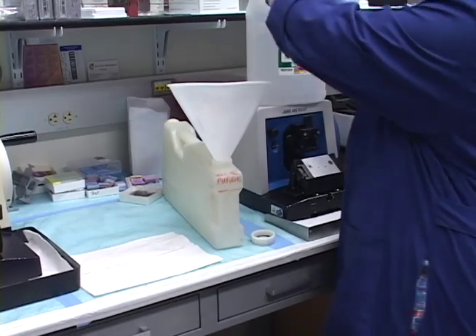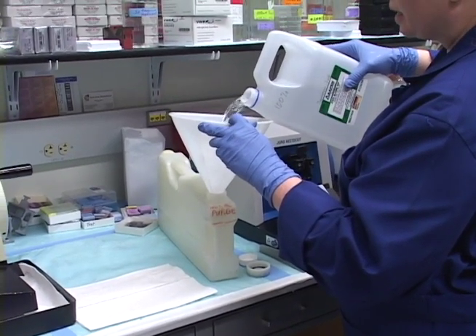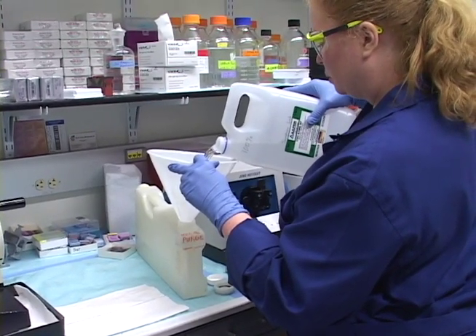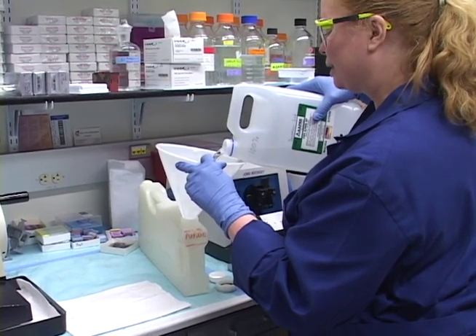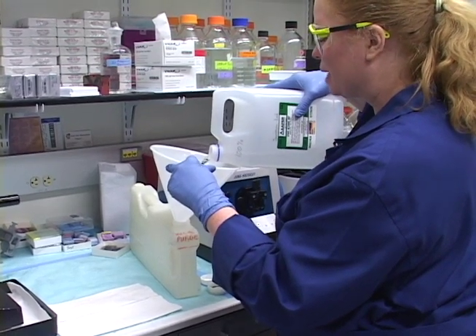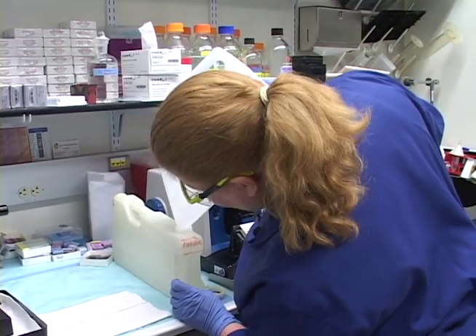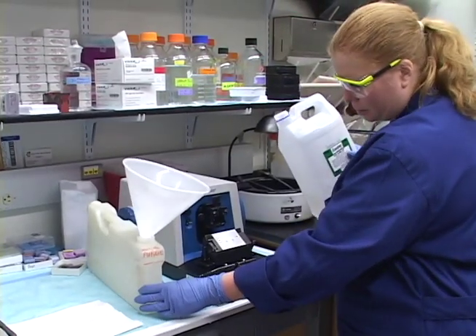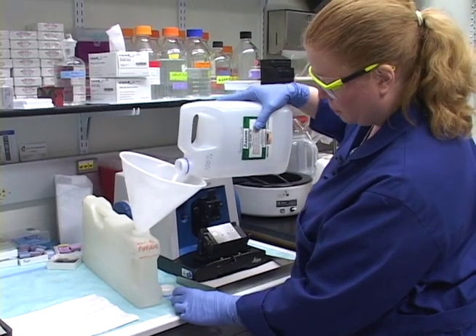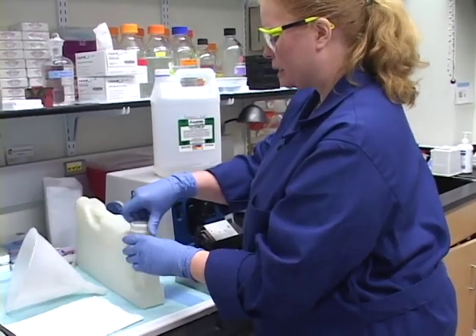So I'm going to use our bulk for the purge. You can fill it up completely to the line — a little bit over is okay. Unlike the xylene, a touch under would be okay here because the alcohol actually cleans out the residual xylene that was pumped in. I'll get this covered right away so it doesn't pick up water from the air.